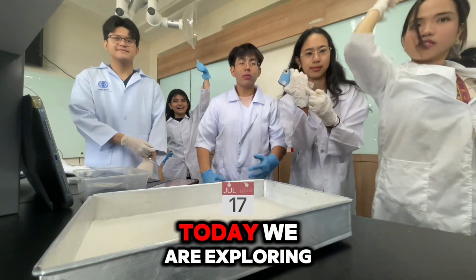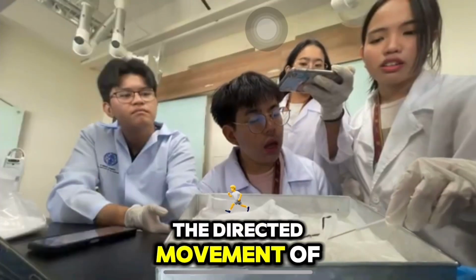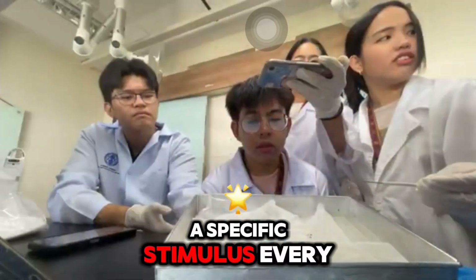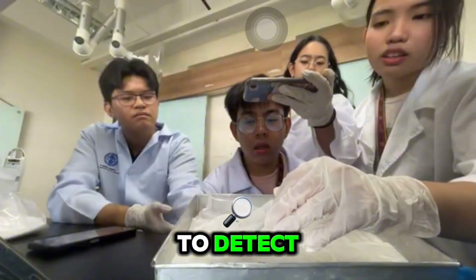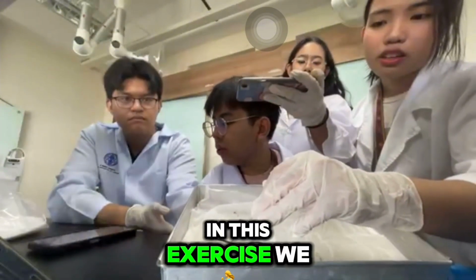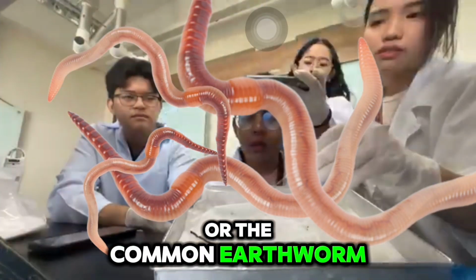Hello! Today, we are exploring the world of animal taxis, the directed movement of an organism toward or away from a specific stimulus. Every living thing possesses irritability, which is the fundamental ability to detect and respond to changes in the environment. In this exercise, we are focusing on the Lumbricus terrestris, or the common earthworm.